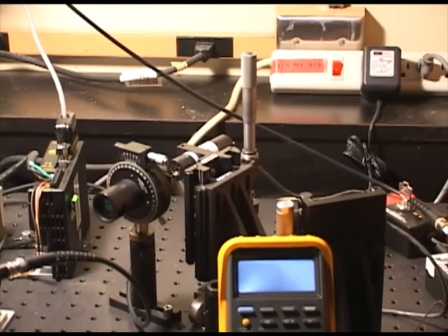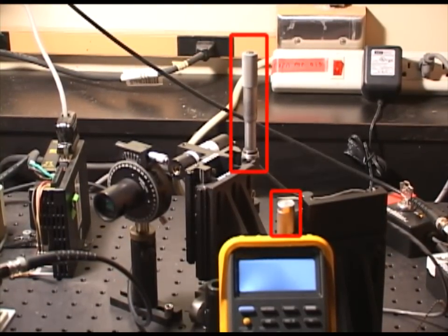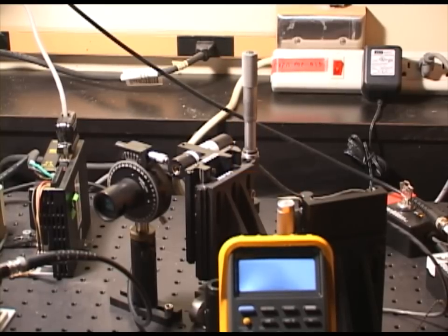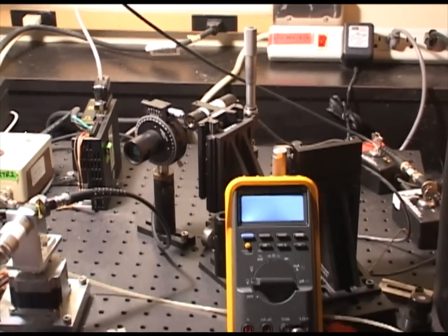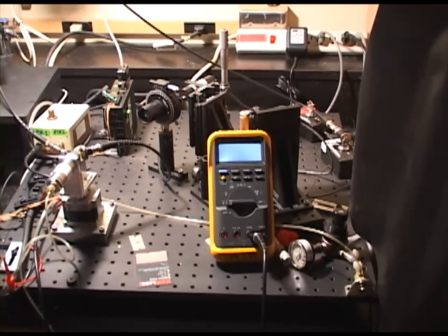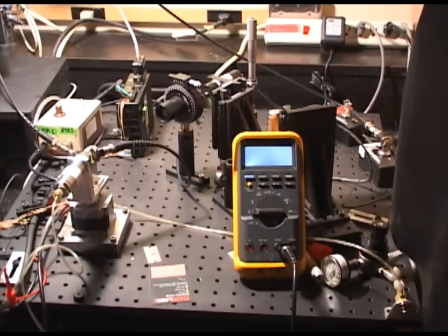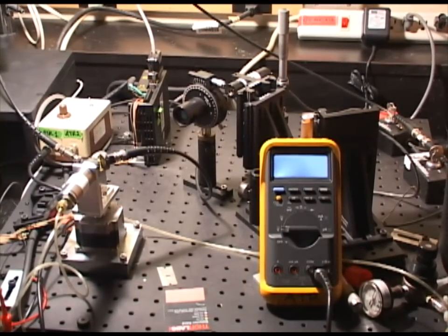To adjust the laser, we use these two rods here which correspond to x and y translation. We'll translate them in each direction until the peak amplitude is found on the diode intensity trace. Then we will adjust the pressure of the pneumatic piston to change the wet spot or coupling of the film to further maximize the amplitude of that diode intensity.